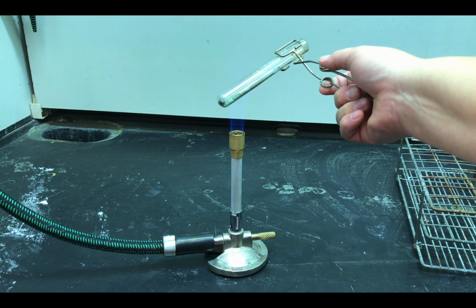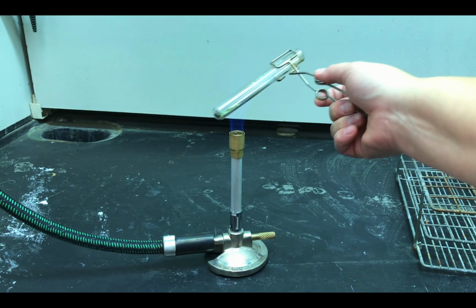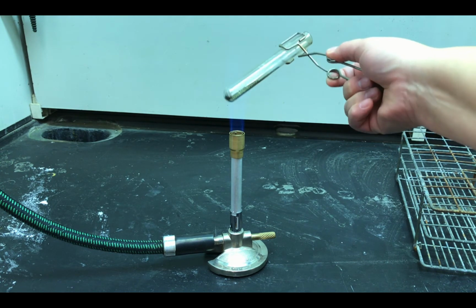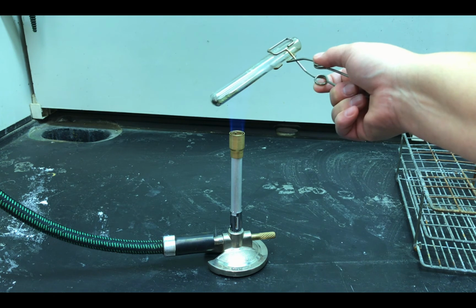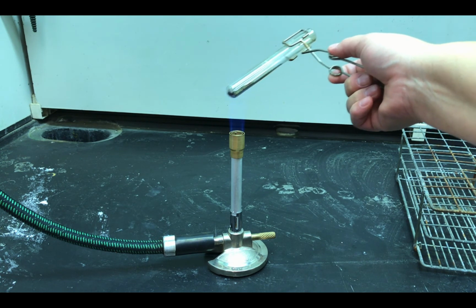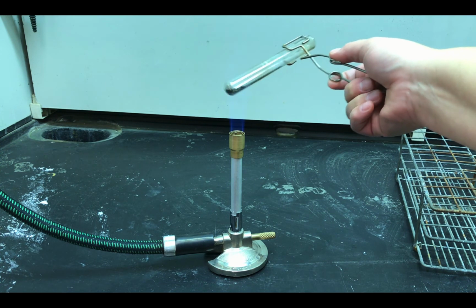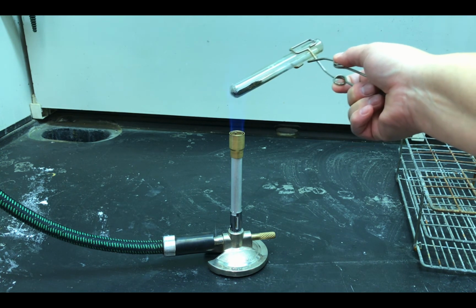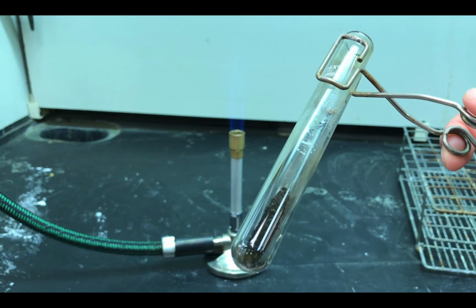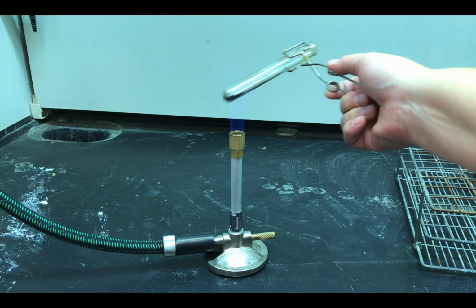I'm sure everyone has had the experience of food that looks done on the outside but is clearly not done on the inside because the heat isn't distributed very well, right? And so maximizing surface area helps to distribute the heat better, right? So we are going to heat our sample until, I said 2 minutes, but really there will be a point at which it is clear that the chemical reaction has occurred, right? And again, make sure you are taking good observations, yes? Observations means the things that we see with our eyeballs.